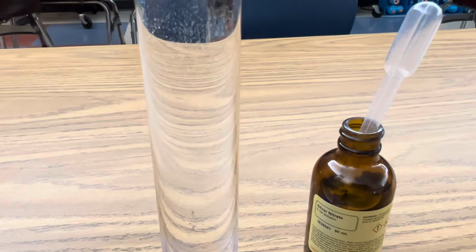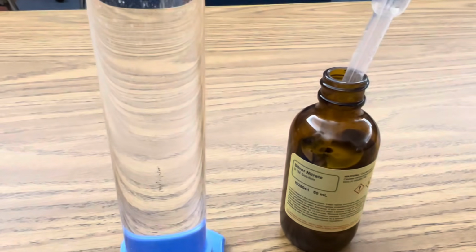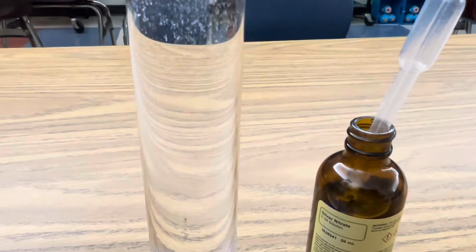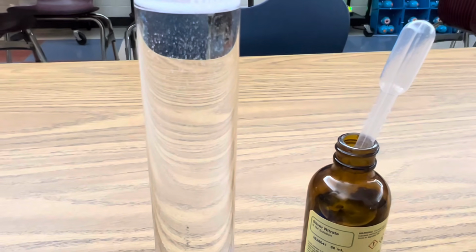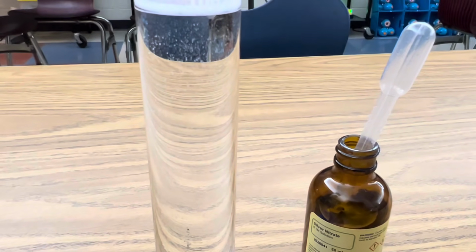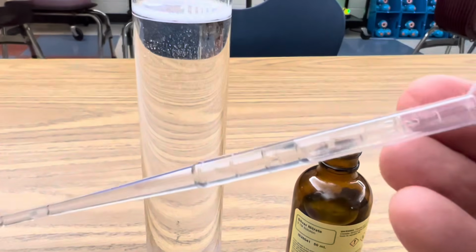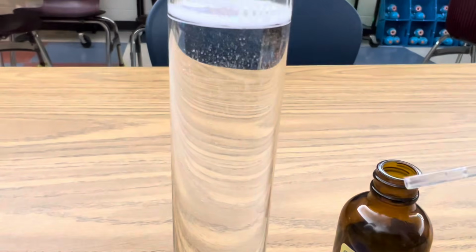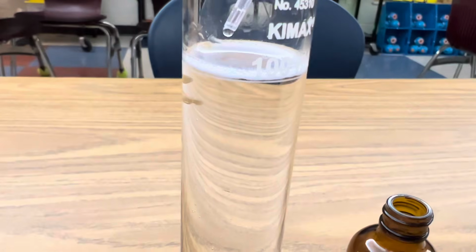Okay, once your potassium hydroxide has dissolved and your solution is aqueous, you're ready to start adding your aqueous solution of silver nitrate. Since this is a double displacement reaction, you'll see the precipitation of silver hydroxide, which will then dehydrate into silver oxide. Your solution of silver nitrate is clear, but when I add it to my solution of potassium hydroxide, look what happens.